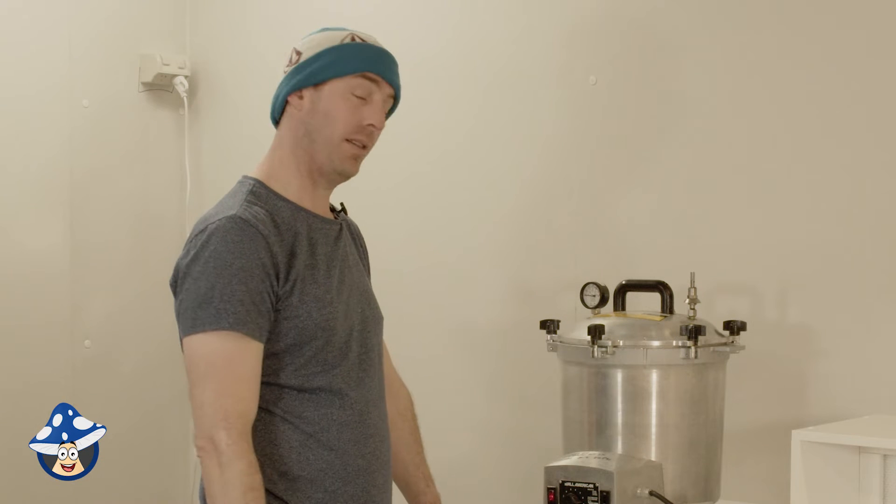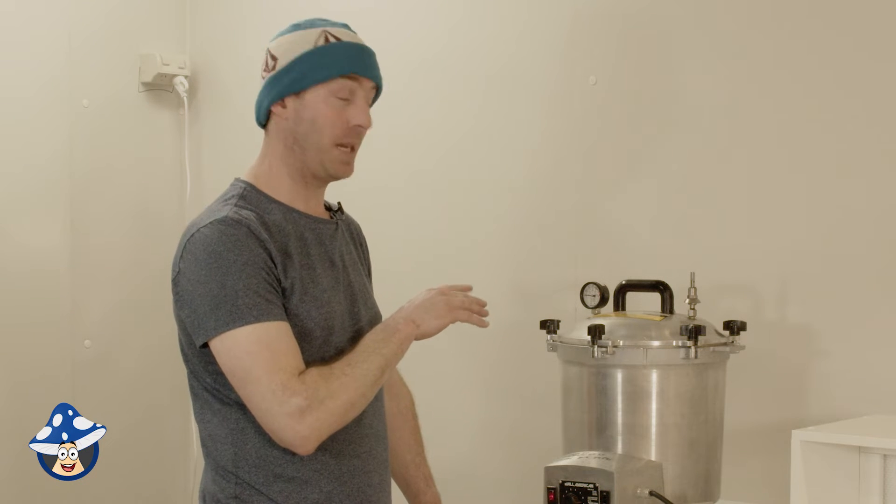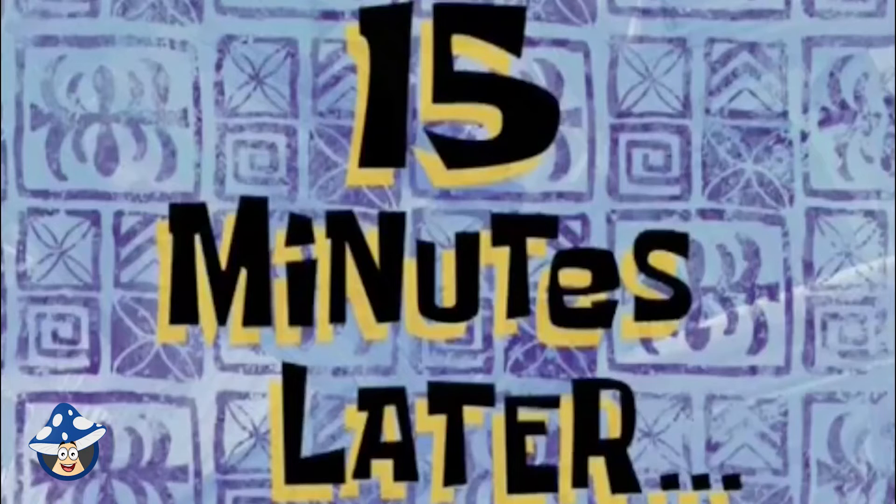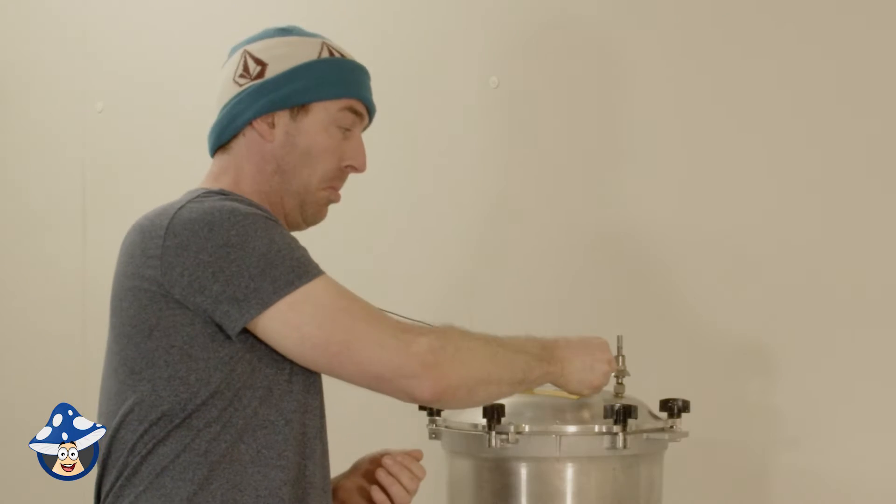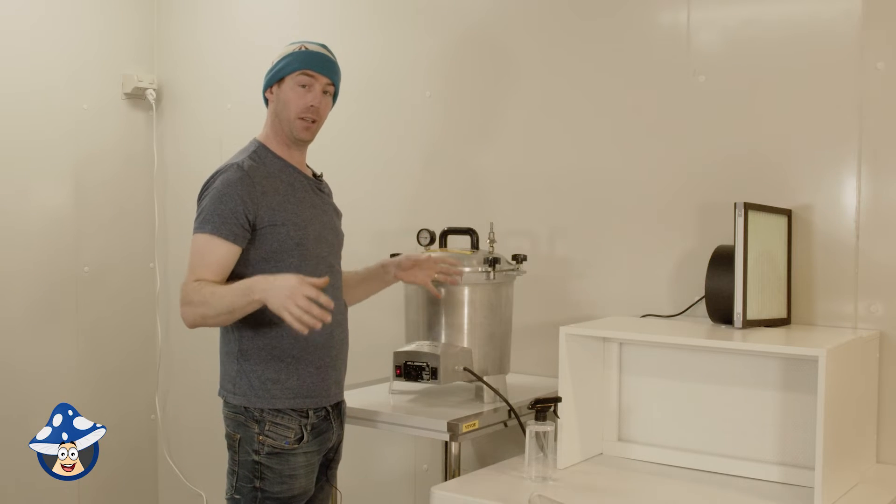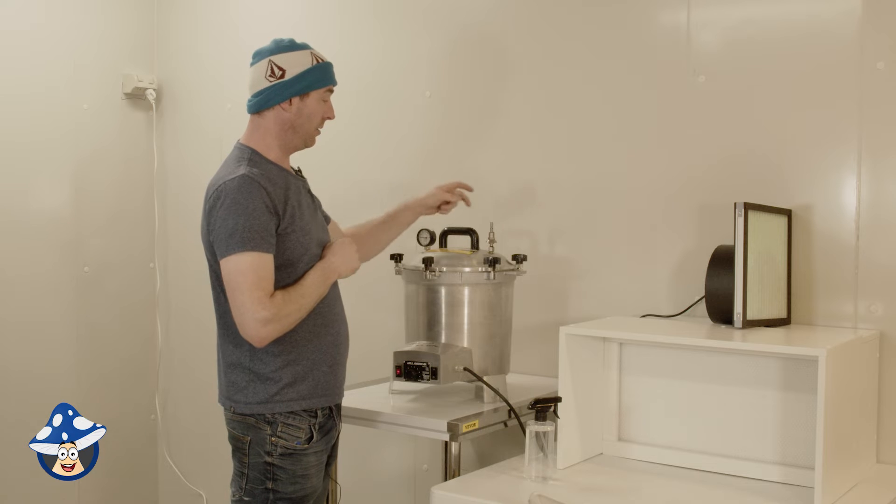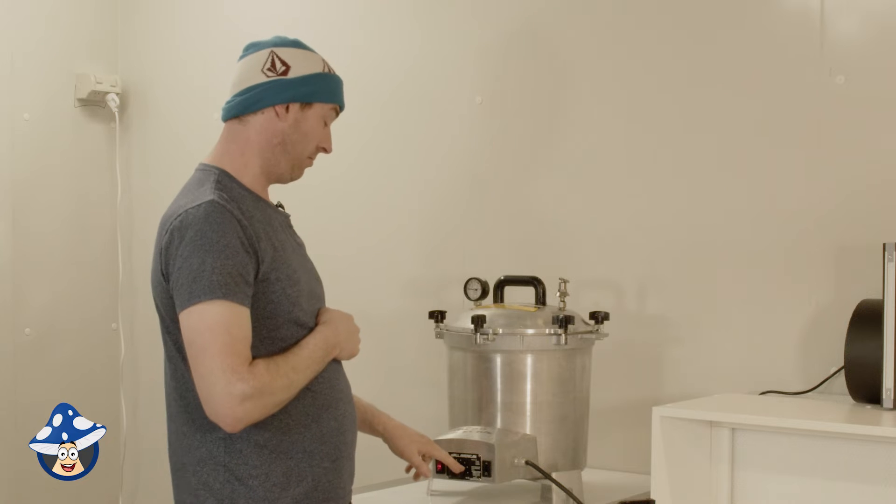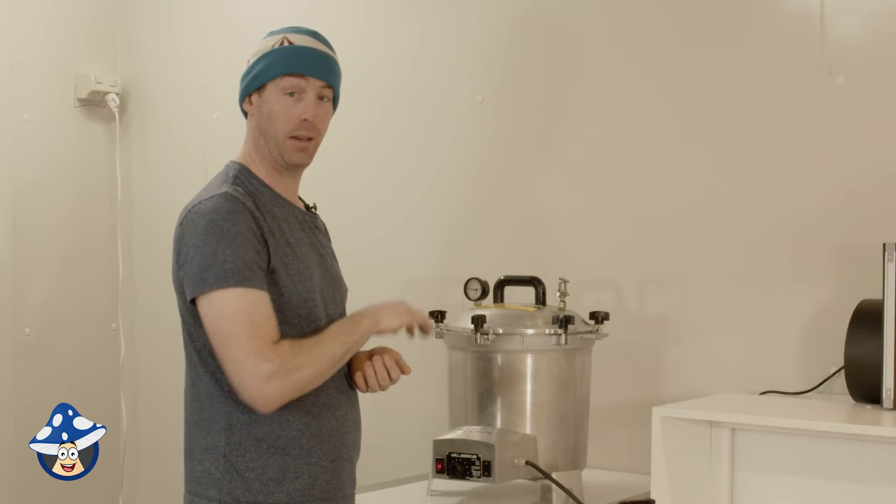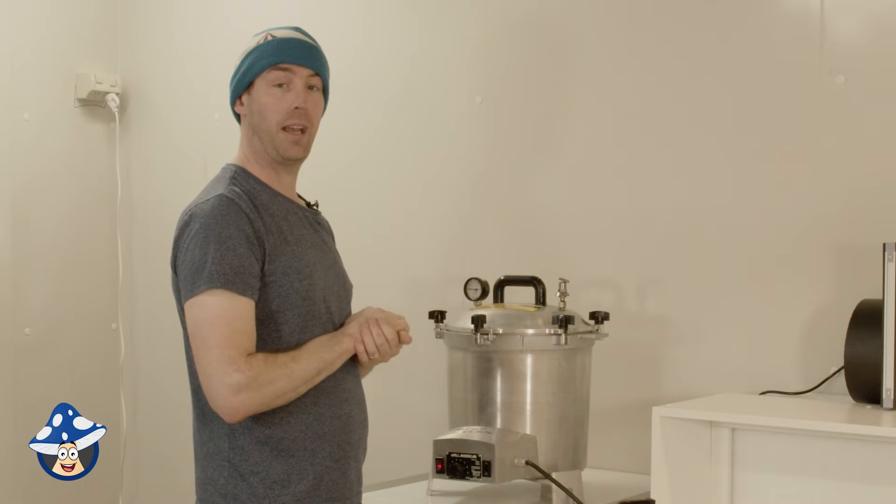All right. It's been about 30 minutes. 15 minutes later. So it's been hissing for at least 15 to 17 minutes. So that gives everything inside a chance to all warm up to that 100 degrees. And then all you do is close it. Now it's closed and it will start building pressure. We've got the dial set on 8.2, which gives us about 18 psi, where it automatically will get to pressure and turn on and off and hold its temperature.